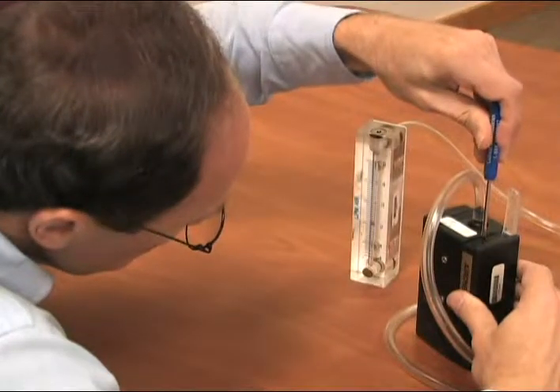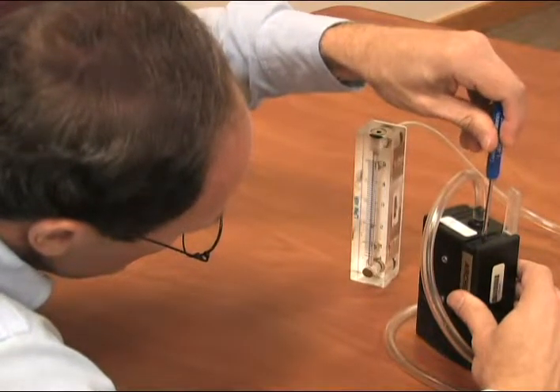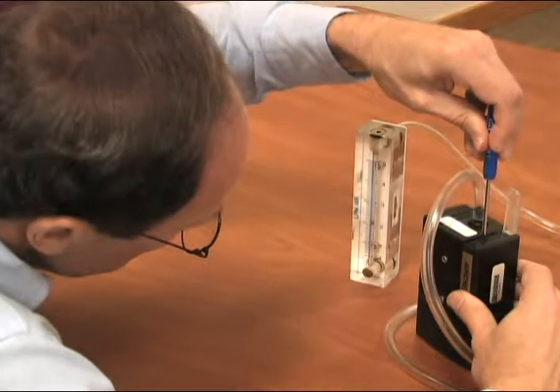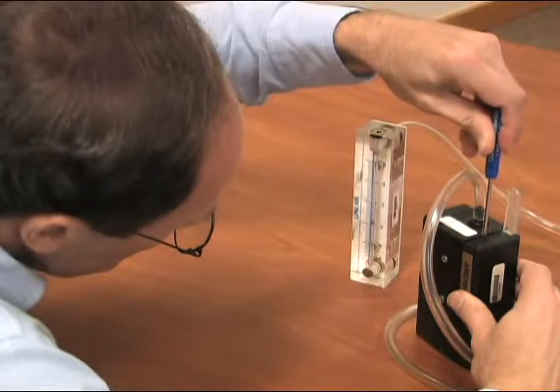With everything sitting on a level flat surface, check the ball float in the rotometer. Adjust the flow rate by turning the flow adjustment screw on the top of the pump until the rotometer indicates the desired flow.